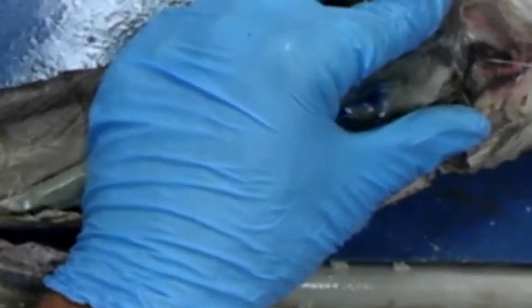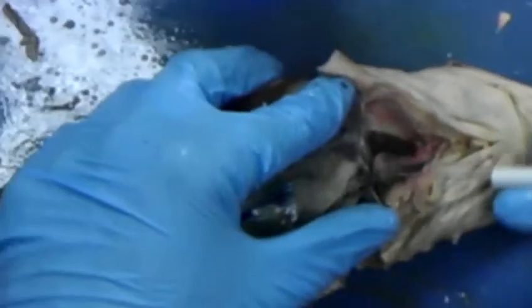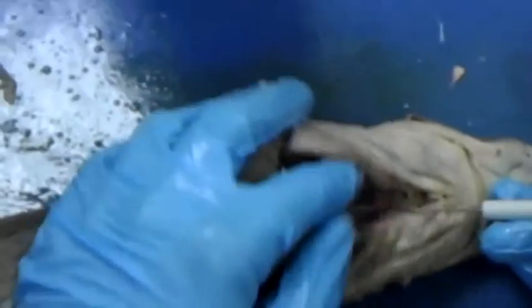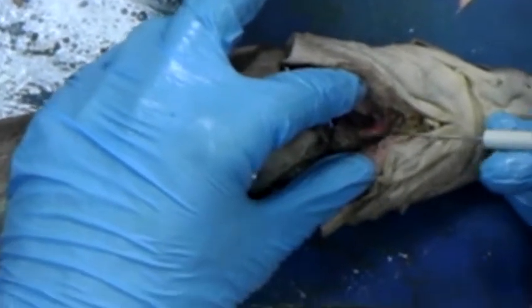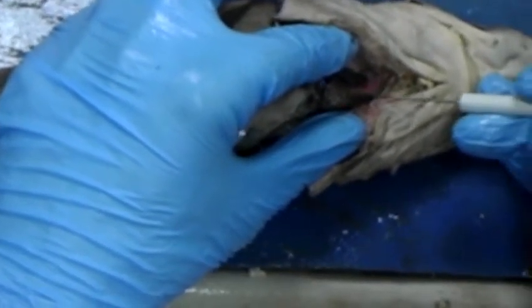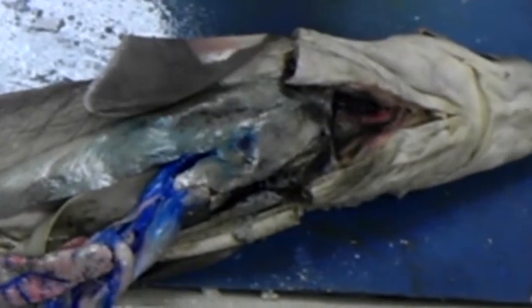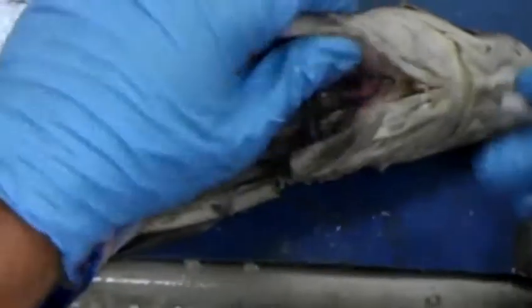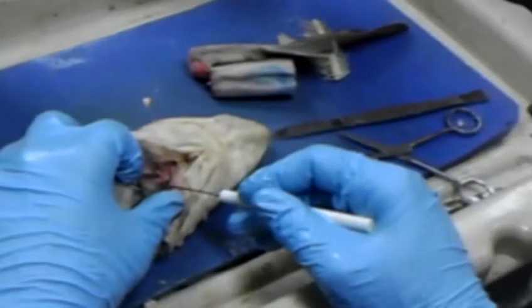So from the sinus venosus it goes into the atrium. From the atrium it is pumped into the ventricle. And from the ventricle, it goes into the conus, or sometimes referred to as the bulbus arteriosus. This is an elastic structure that as soon as it's pumped, it fans out and then slowly releases the blood. And in the live specimens, this is white, but it's not so white, it's cooked.